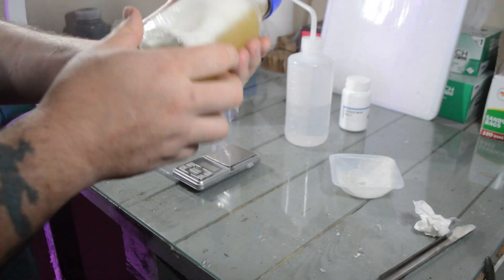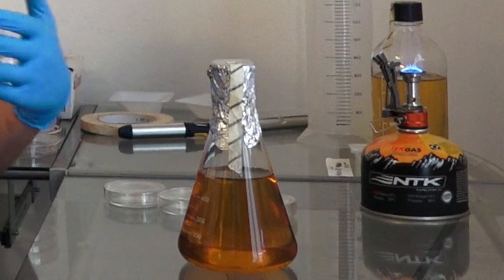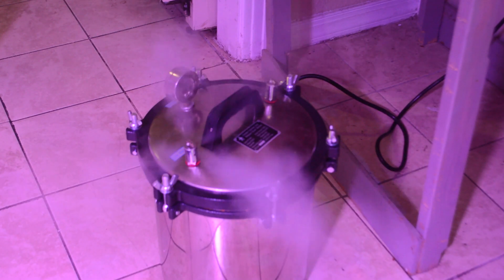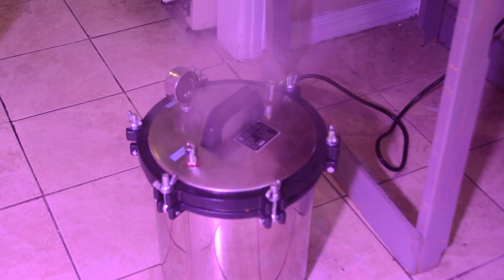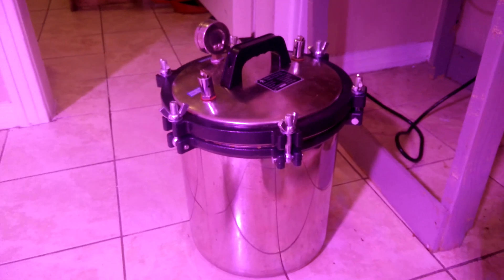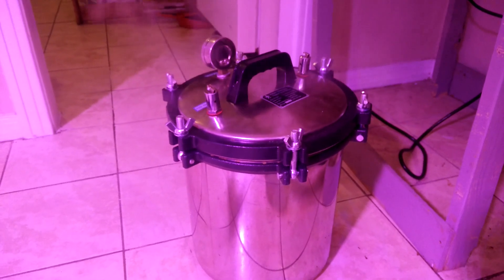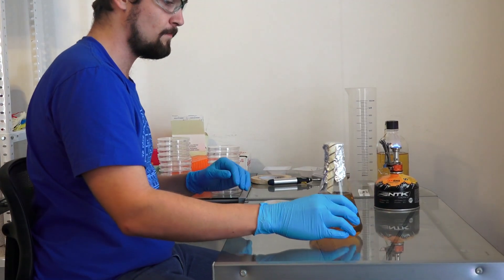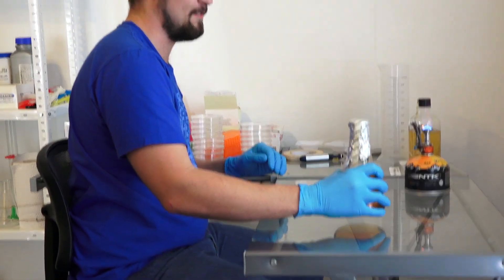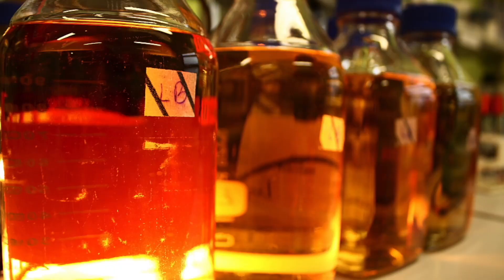To make sure the only organism growing is the one we want, we'll need to sterilize the media. This has the added benefit of melting the agar to make it castable. Put the lid on the bottle but leave it partially unscrewed so it doesn't explode in the autoclave, then tape it closed with autoclave tape — this stuff changes color to tell you when an item is properly sterilized. We're using a big electric autoclave prefilled with reverse osmosis water. It will vent air once it hits the set pressure; at that point set a timer for 20 minutes, then turn it off and let things cool. Since we're making agar plates, don't wait too long or it'll solidify in the bottle — as soon as the autoclave has depressurized, carefully collect your bottle while it's still warm.